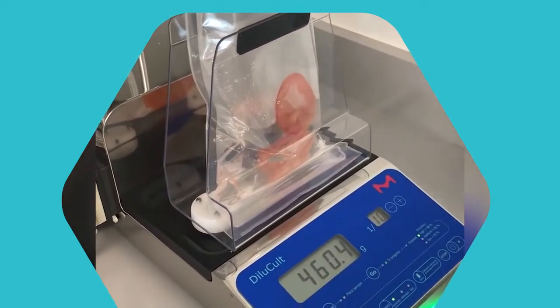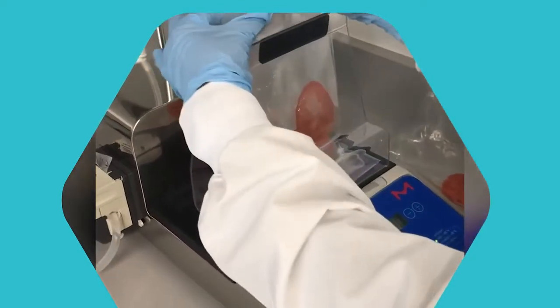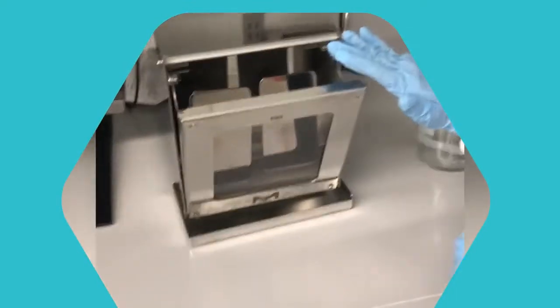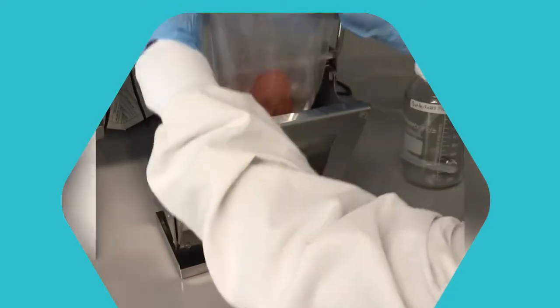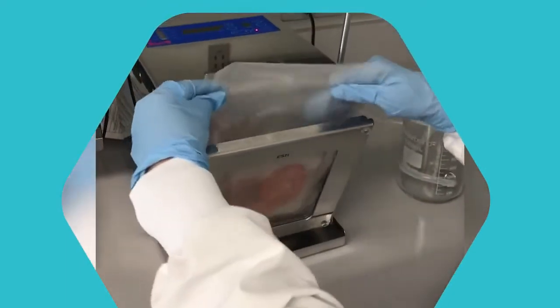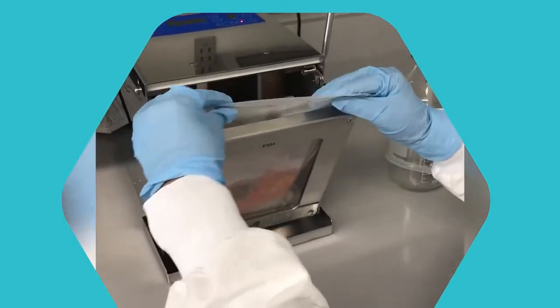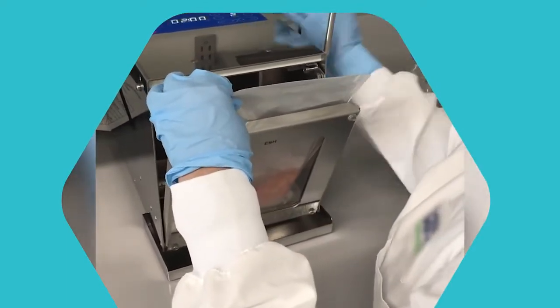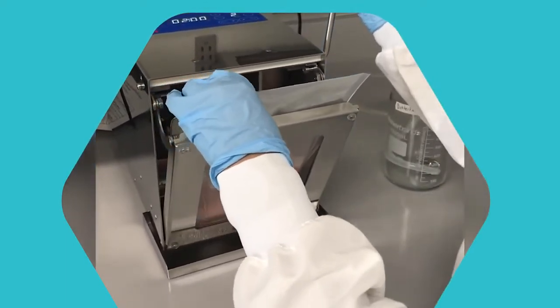So now it beeped and our dilution is done. I'm going to take our sample and we have our homogenizer here. I'm going to put our sample in this. It will basically blend our sample when we're ready for extraction. It's going to do it for two minutes.